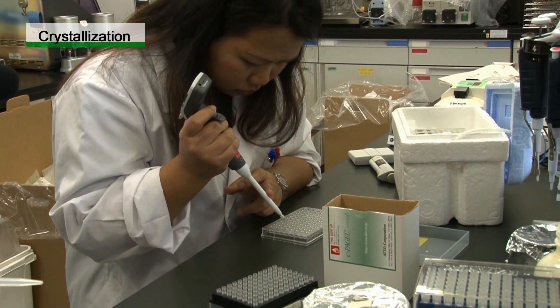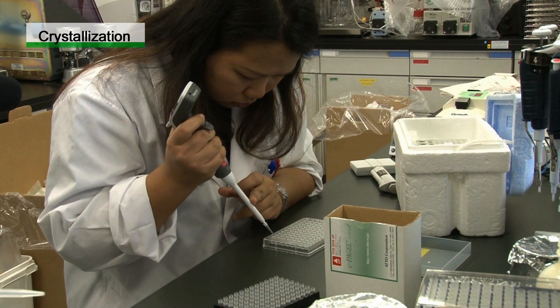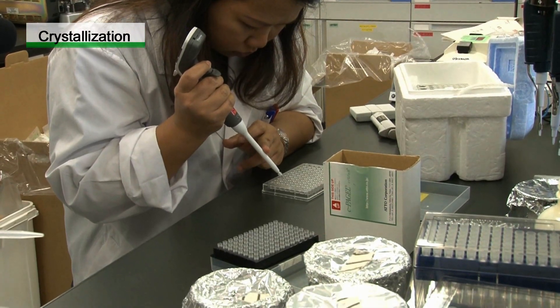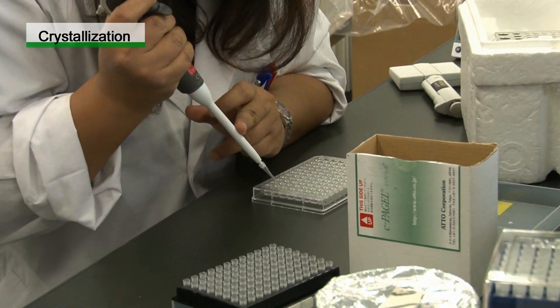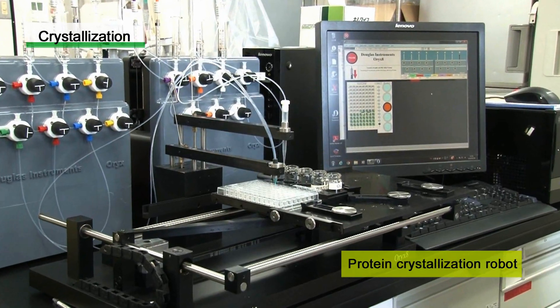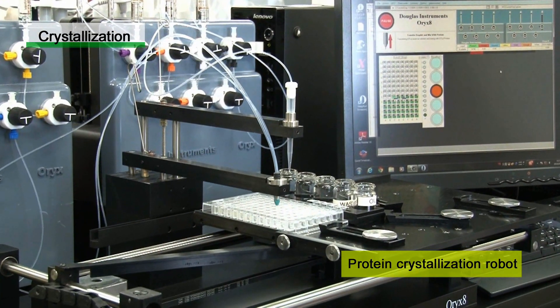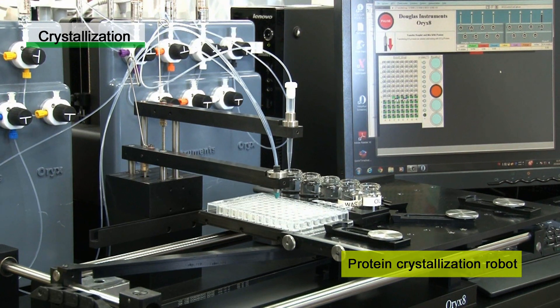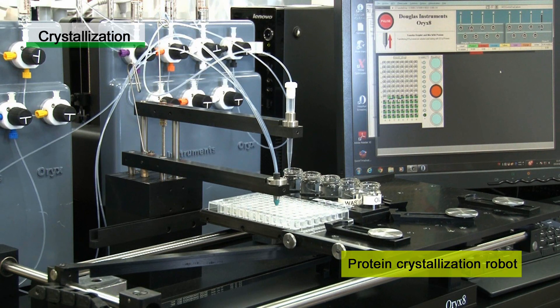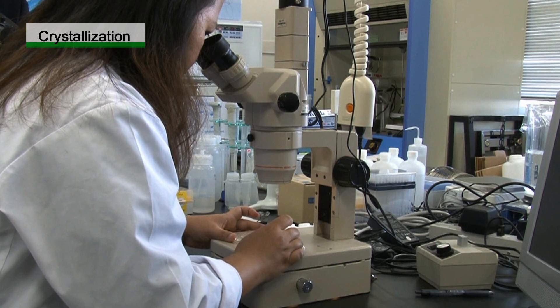After purification, a precipitant is added to the protein solution to crystallize the protein. Because the crystallization conditions vary depending on the type of protein, a number of trials are needed to find suitable conditions. Currently, robots are being used to crystallize proteins. The use of crystallization robots enables a larger number of trials under various conditions with smaller amounts of proteins, and increases the chance of finding suitable crystallization conditions.